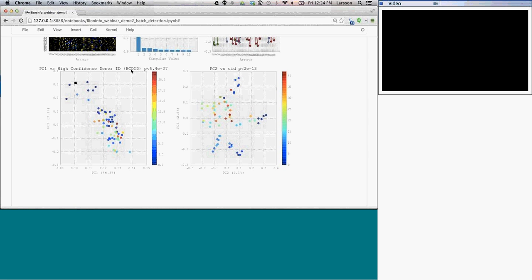What we see here is that the first one captures 46%, and it's associated with high confidence donor ID. It turns out in this data set, if we look at the metadata, there are multiple samples taken from the same donor, sometimes turned into stem cells using different protocols, but they're the same individual. And so that has a strong effect and explains most of the variation. And then the second PC here is associated with cell of origin, and the reason is sometimes we have multiple repeats of the same cell. So that's a good sign that we're seeing that as a strong PC here.